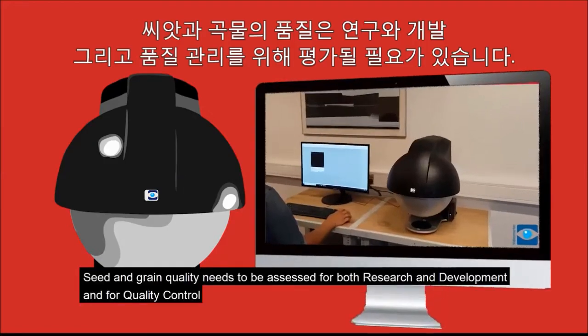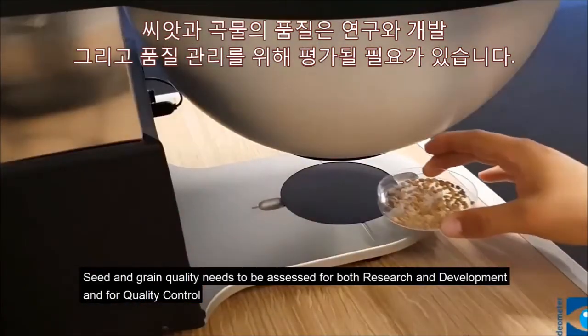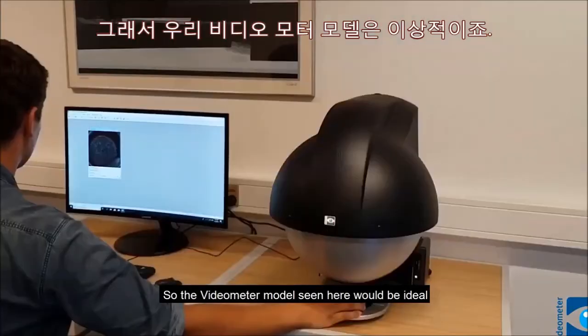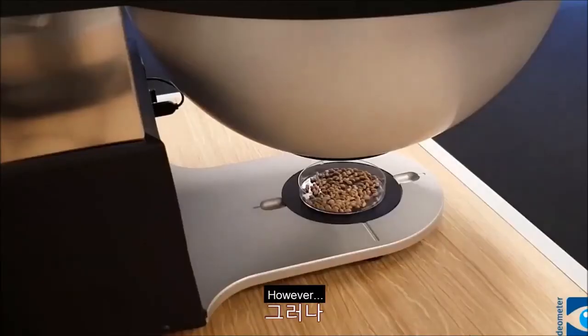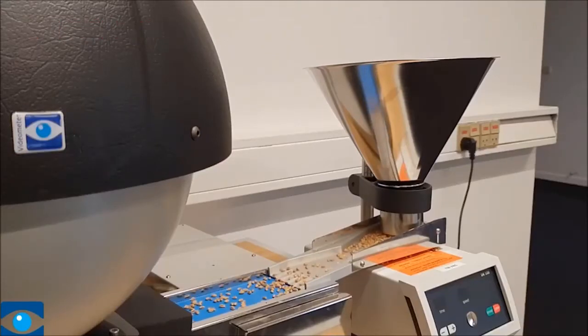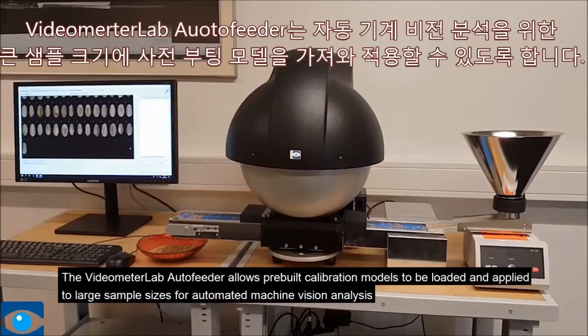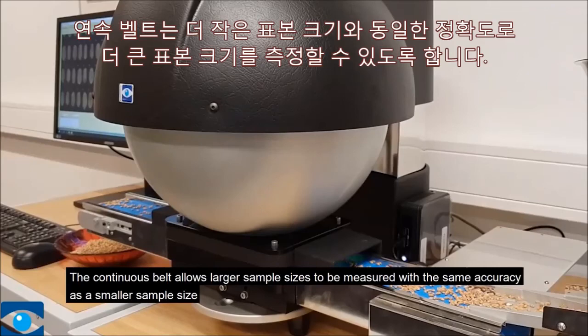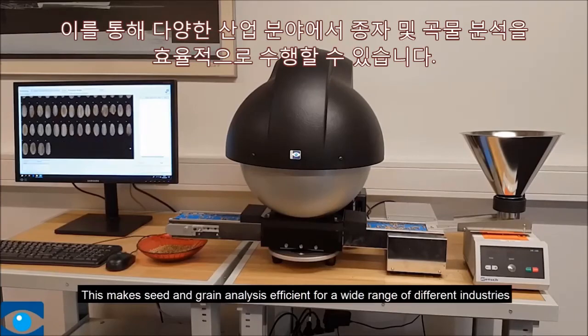Seed and grain quality needs to be assessed with both research and development and for quality control. Research and development would typically use smaller sample sizes, so the Videometer model seen here would be ideal. However, quality control inspection can require much larger sample sizes to be measured. That's where the Videometer Lab Auto Feeder comes in. The Videometer Lab Auto Feeder allows pre-built calibration models to be loaded and applied to large sample sizes for automated machine vision analysis. The continuous belt allows larger sample sizes to be measured with the same accuracy as a smaller sample size. This makes seed and grain analysis efficient for a wide range of different industries.